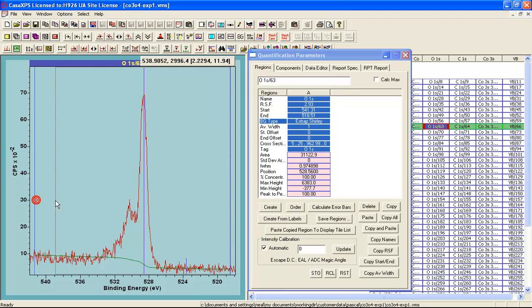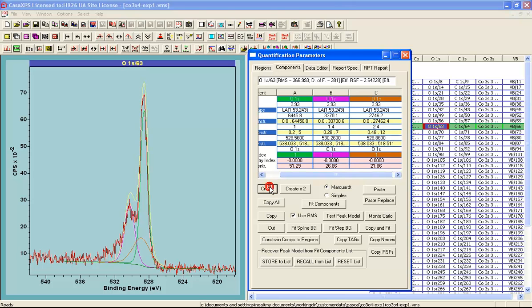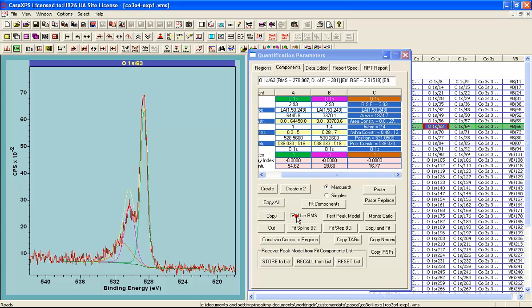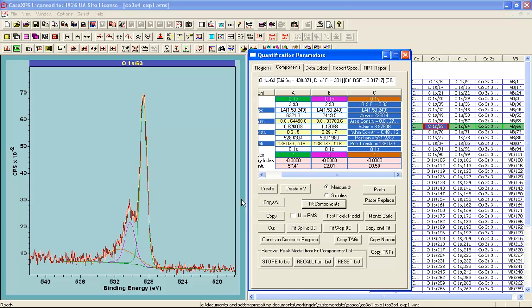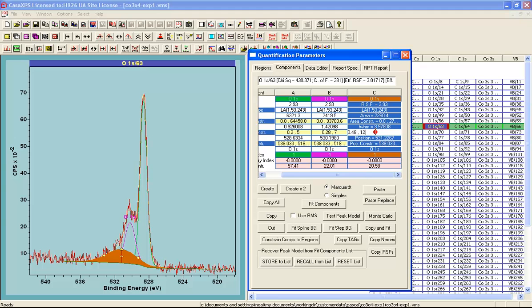And with the background, we'll add components. I'm going to put three components in here and then say fit. I'd rather these be similar in full width half maxima. So I'll introduce a constraint between B and C, and they then fit again.